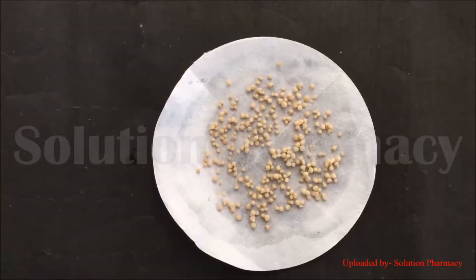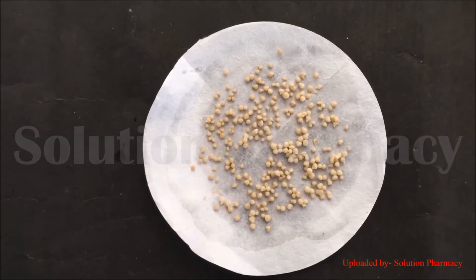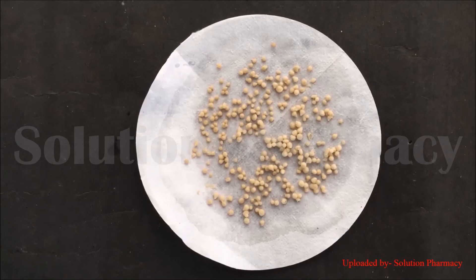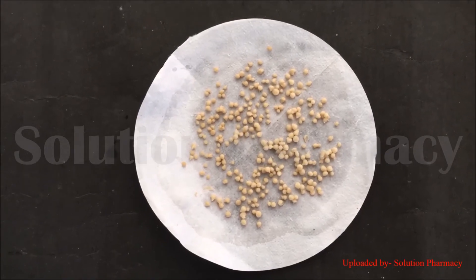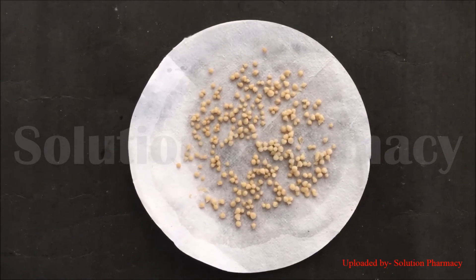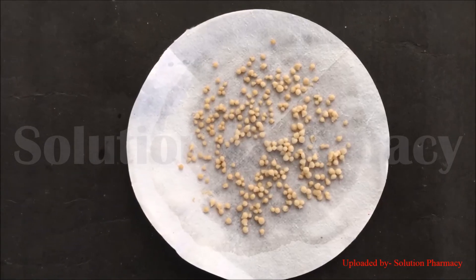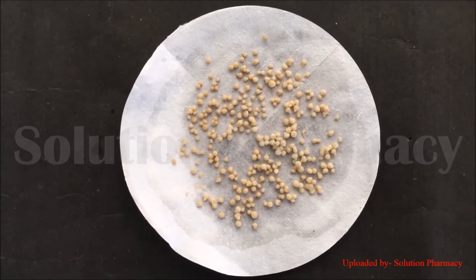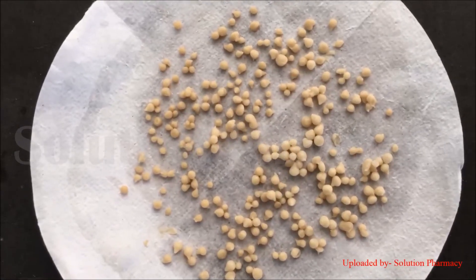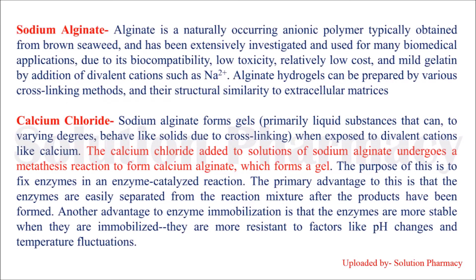Then transfer the beads onto filter paper to dry — the filter paper will soak up the extra water from the beads. And this is how we immobilize yeast cells in calcium alginate beads by the gel entrapment method. Thank you very much for watching this video.